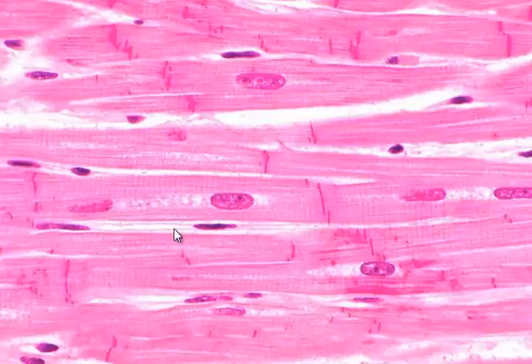Each one of these cells is actually very tube-shaped, so you're looking at horizontal and vertical lines, but if we rotated this 90 degrees so that these cells were facing you, so the ends were facing you, you'd be seeing a bunch of circles because these are circular or cylindrical shaped cells. And so each one of these darker purple or darker pink lines is actually the side view of a disc. So looking at the side view of a frisbee, you can't tell that it's circular until you turn it 90 degrees to the right or left.